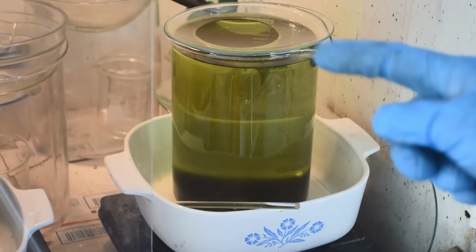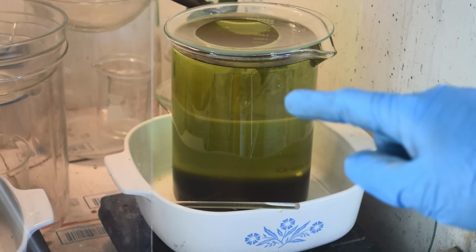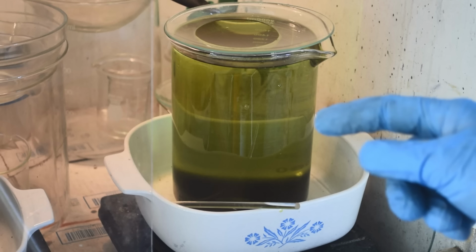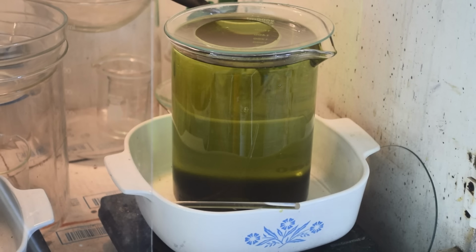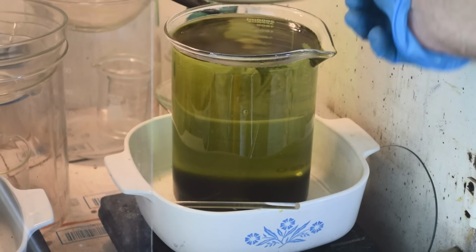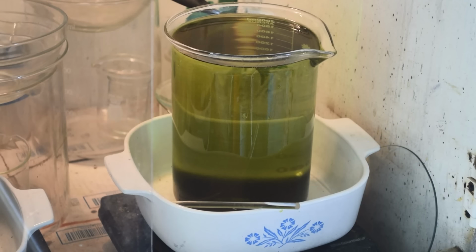It doesn't hang around in solution for a long time, even the fine particles, because if you use an SMB, it produces a lot of sulfur dioxide gas, and those gas bubbles buoy up the fine pieces of gold, and they don't want to settle out. You wind up having to boil it maybe to degas it and get the liquid to settle. It can take a very long time.